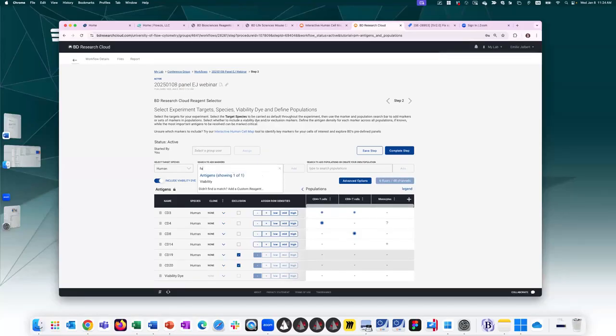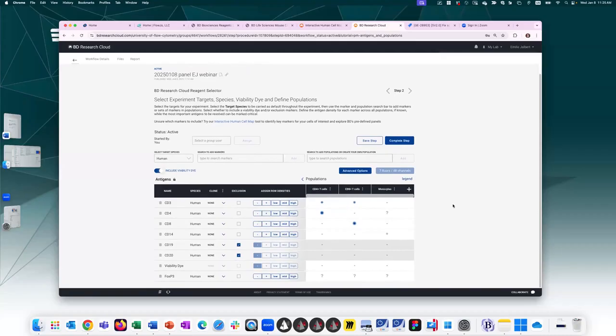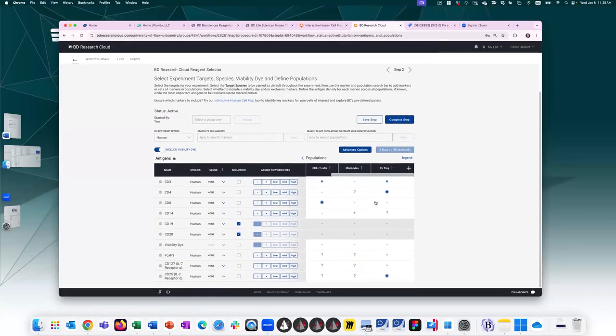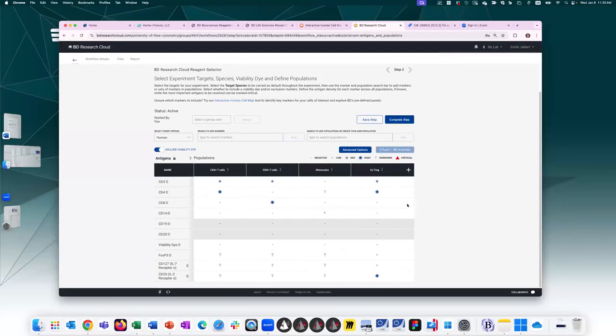So for example here, I'm just going to use FOXP3, add it here because I'm going to do FOXP3. Oh, you know what? Here, let's go ahead and delete it. I had created my EJ-FOXP3. That's what I meant to do. So let's go ahead and add my EJ-Treg population. So now it's showing up here. That was the population I highlighted when I was in the population section. So it automatically brought in the high or low antigen density information, and it put question marks where it wasn't a part of the definition. So I'm just going to fill in the blanks here. For the EJ-Treg, I'm not going to look specifically at the CD4. I'm going to focus on the EJ-Treg for today's purposes.